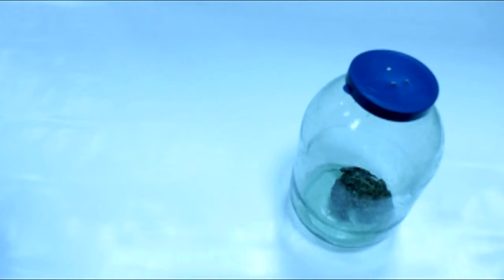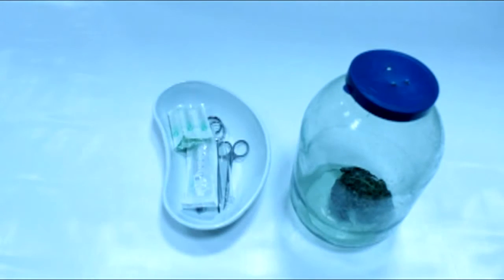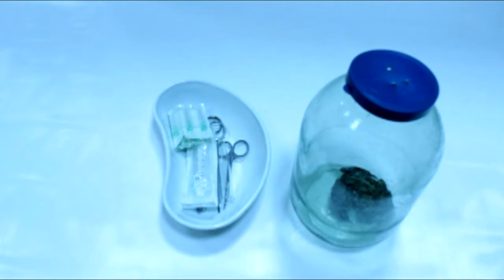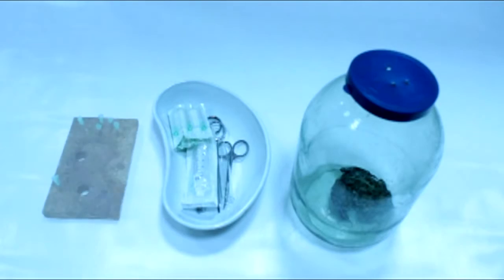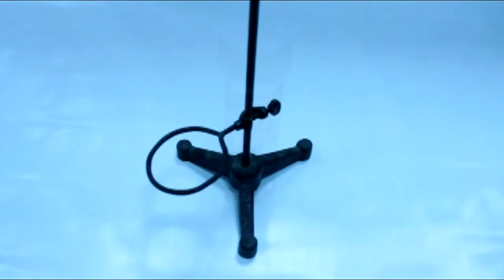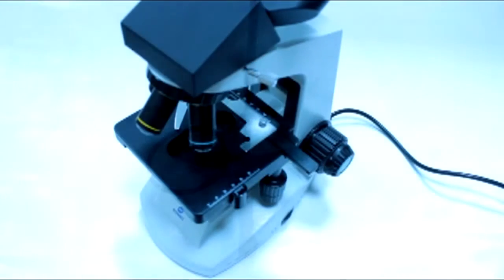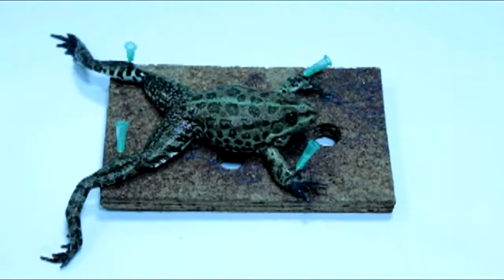To perform this experiment, we need the following equipment and reagents: 1. A frog, which is the object of the experiment. 2. Pins, anatomical tweezers and tongs. 3. A corkboard and a solution of hydrochloric acid. We also need a laboratory tripod and a light microscope.